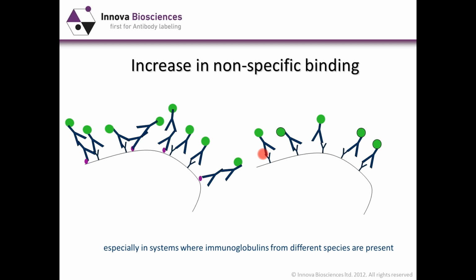If we look at a similar thing in a flow cytometry or a cellular-based assay, here we have a cartoon representation of a B lymphocyte. Now, a B lymphocyte will have immunoglobulin on its cell surface, seen by these smaller antibody molecules here. We also have antigen on the surface of the B lymphocyte, and this is being detected by your primary antibody here. When you add your secondary antibodies, they bind to your primary antibody, but they will also potentially cross-react with the surface immunoglobulin. This is particularly a problem if you're using rodent systems, so perhaps these might be mouse cells and your primary antibodies are rat monoclonals, or vice versa. But you can have cross-reactivity between immunoglobulins from different species right across the species range.